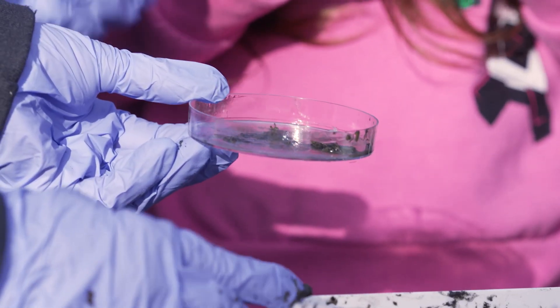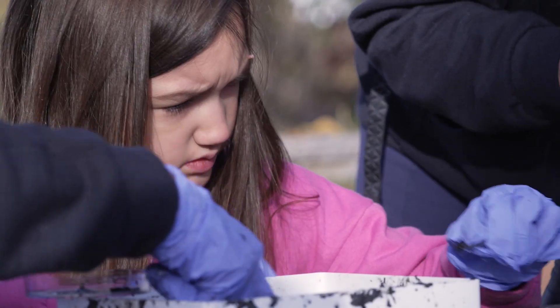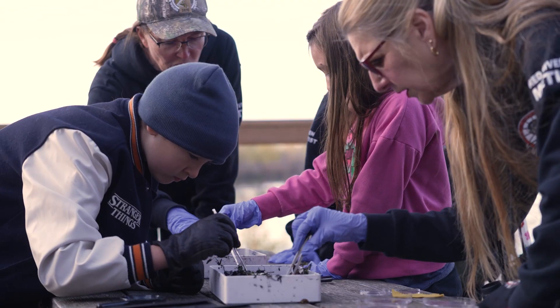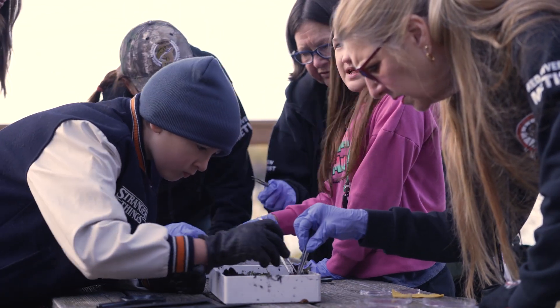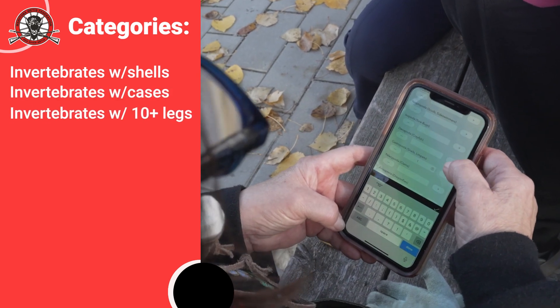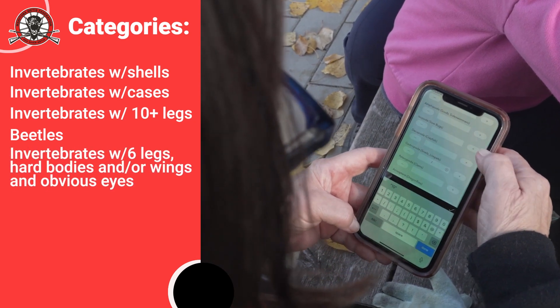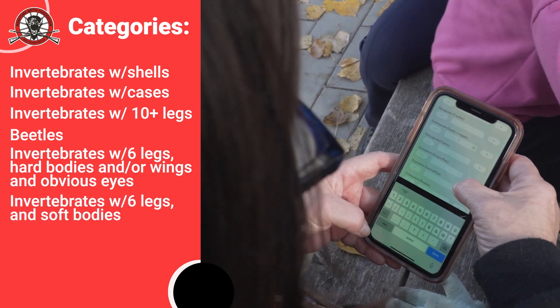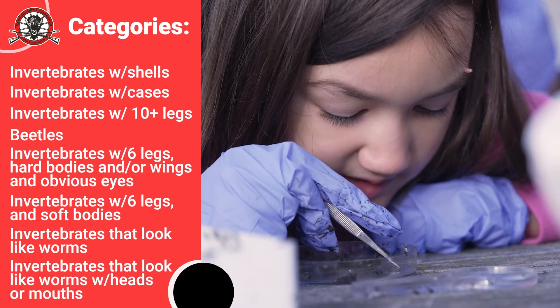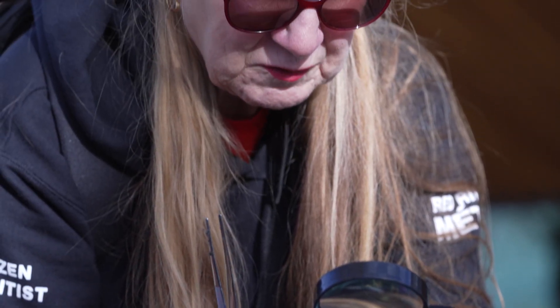Using forceps, pick all invertebrates out of the tray and transfer them to a separate container such as a petri dish or a small tupperware. Do not examine any large invertebrates in your hand. Next, sort all of the invertebrates collected into similar types and record how many you've collected from each category, including invertebrates with shells, invertebrates with cases, invertebrates with more than 10 legs, beetles, invertebrates with six legs and hard bodies and/or wings and obvious eyes, invertebrates with six legs and soft bodies, invertebrates that look like worms, and invertebrates that look like worms but have heads or mouths. A hand lens or magnifying glass, along with the images in your pocketbook, might be helpful for the next step.